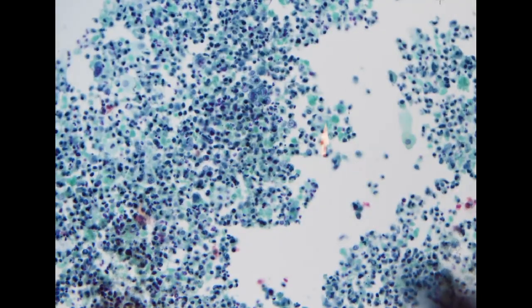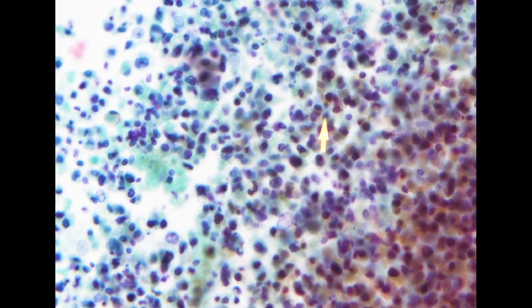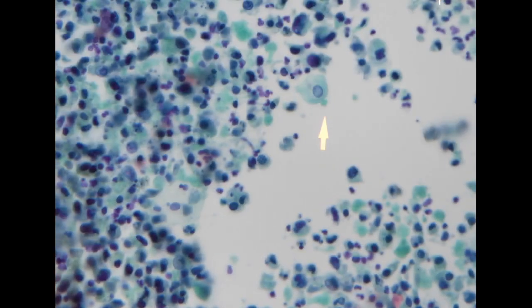For typical high-grade urothelial carcinoma, the following two specimens are both voided urine specimens. Usually we will see tons of cells, the majority of them individual cells, and we like to see individual cells with higher NC ratio. In this specimen, the cellularity is really high. However, the majority of the cells do have marked degeneration, almost like a necrotic pattern.